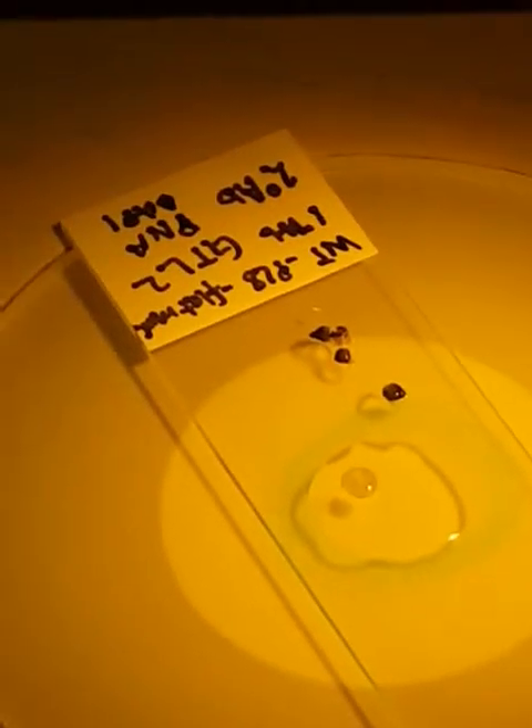What we have to do now is remove the lens. There's a lot of water there so I have to remove some. I'm going to remove a little bit of PBS to help with the surface tension.